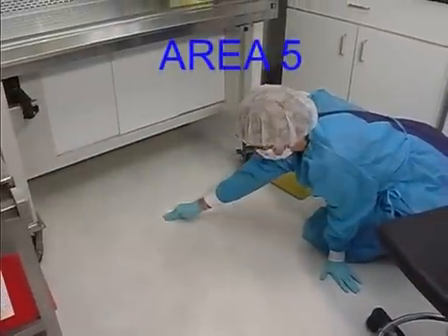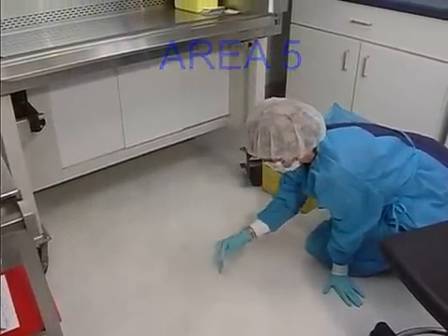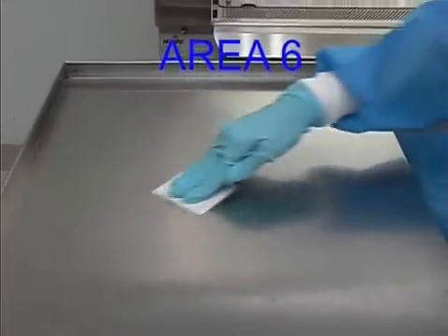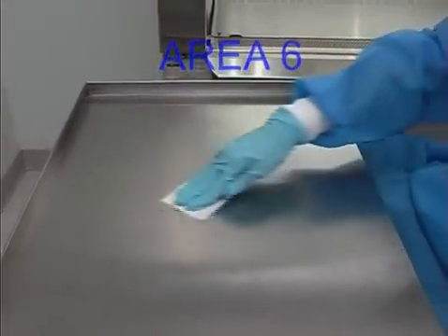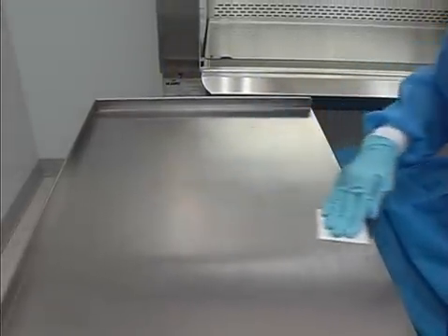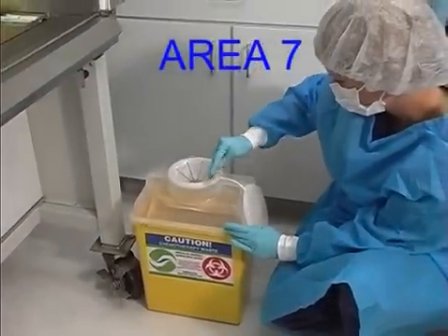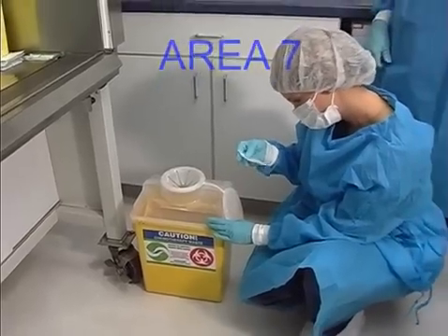Area 4: The entire front grille and lower threshold or lip of the BSC. Area 5: The floor in front of and under the hood. Area 6: The countertop or work surface where the product was placed upon removal from the hood. Area 7: The outside of the chemo waste container.